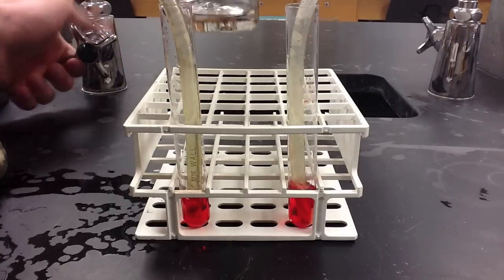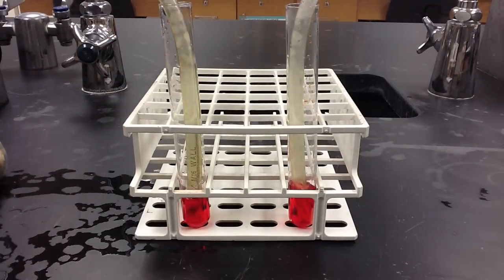I again refill the beaker for the second apparatus, again remove the rubber stopper from the thistle tube, and pour the water into the apparatus. As I do, the phenol red begins to bubble, and as you will notice here, there's a distinct color change from red to a yellowish color, denoting that carbon dioxide indeed was present in this particular apparatus.